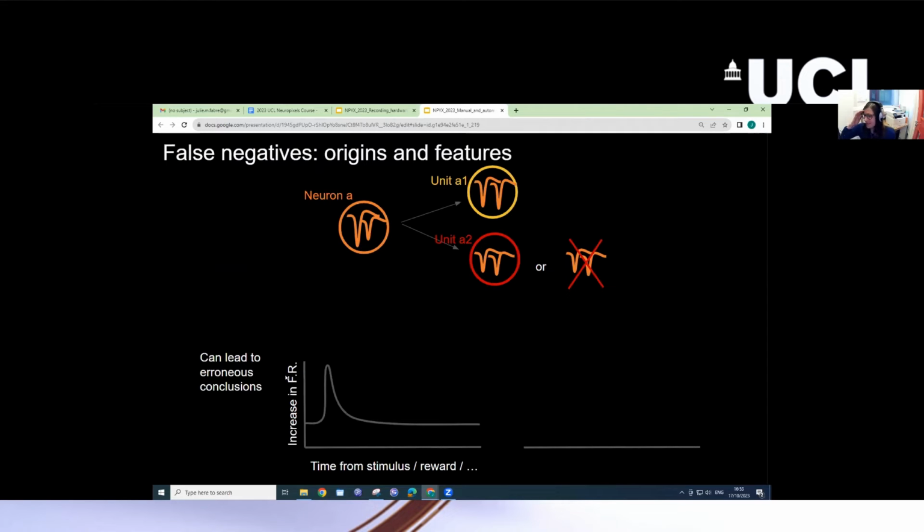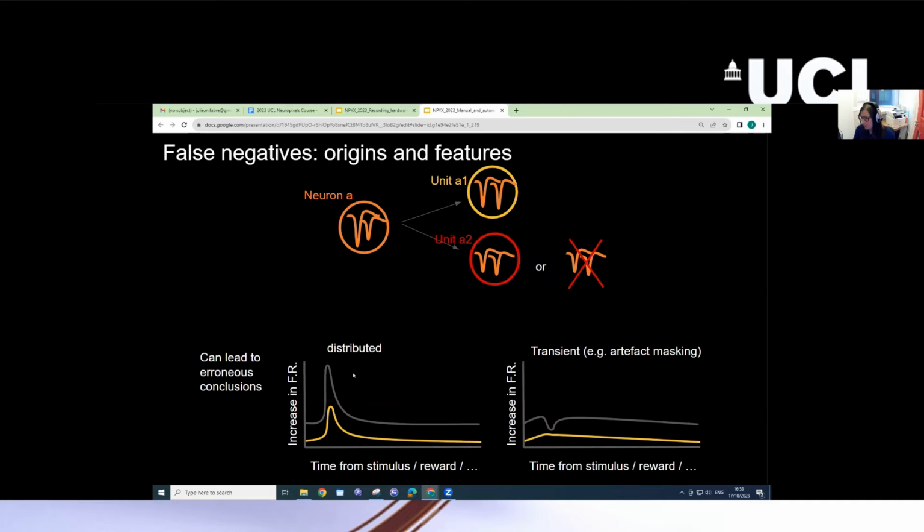And false negatives is the opposite. So you have spikes from a neuron, which can have some variability, for instance, in amplitude. Not all spikes are entirely identical. These can mistakenly be separated into two different units, here A1 and A2, when in fact they originate from the same neuron. Another option is also if there are lower amplitude spikes, these can simply not be detected at all. And this can also lead to erroneous conclusions where you perhaps think that your neuron has a lower firing rate than what it truly has, perhaps a lower response. This is in the case of distributed false negatives.